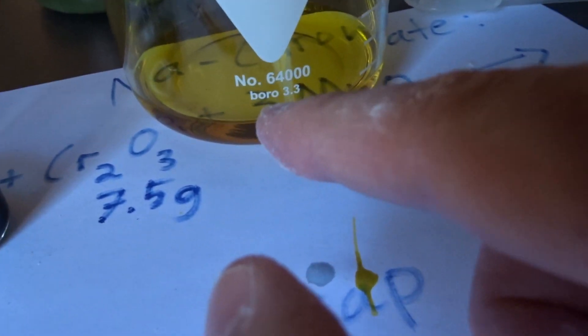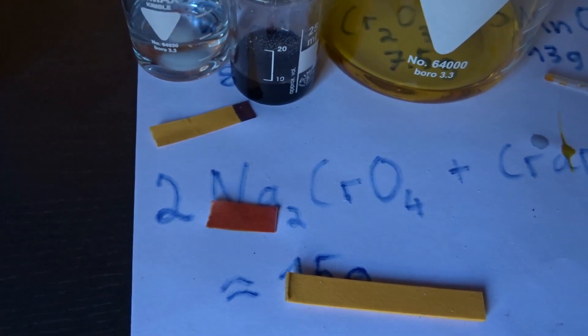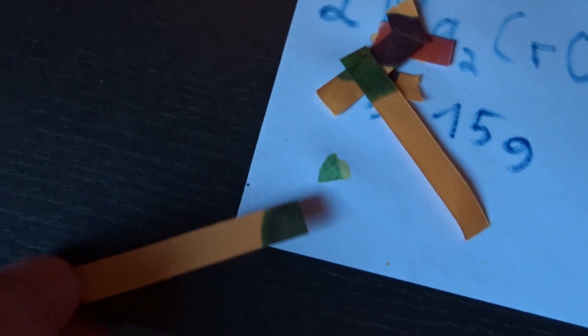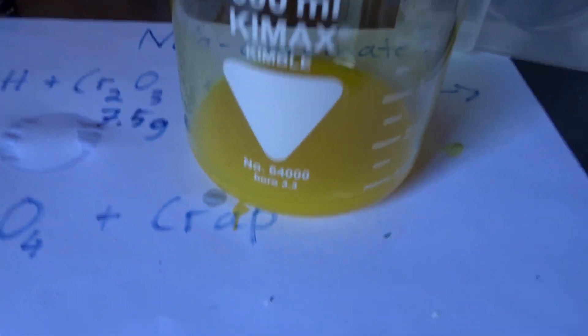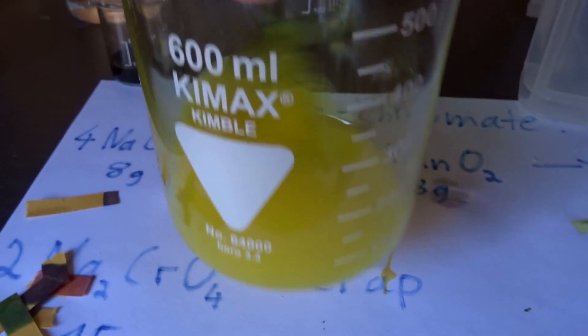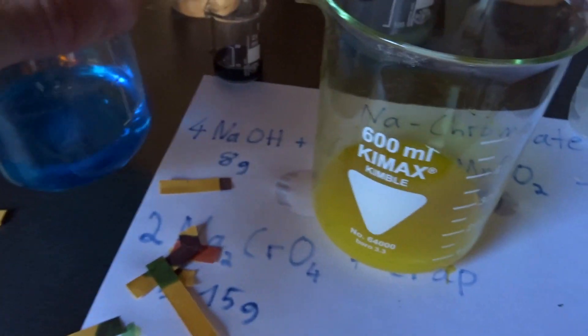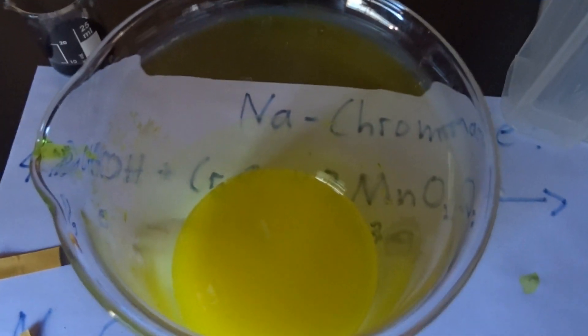So I'm going to convert this now to copper chromate. So basically just this thing here only with copper there. After a lot of adding acid and base forth and back I managed a bit of a green plus which is something like a pH around 8. That should be sufficient. On now adding copper sulfate which I have here. This copper sulfate reaction solution will react with the little bit cloudy chromate now to form copper chromate.